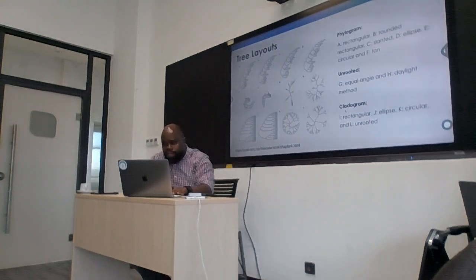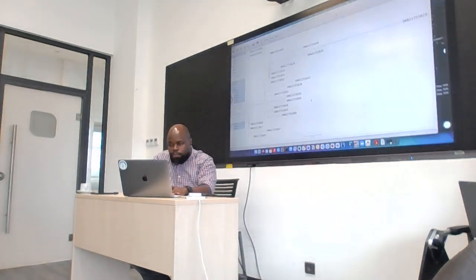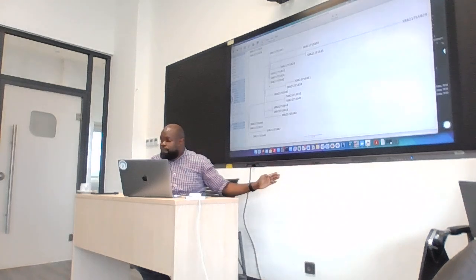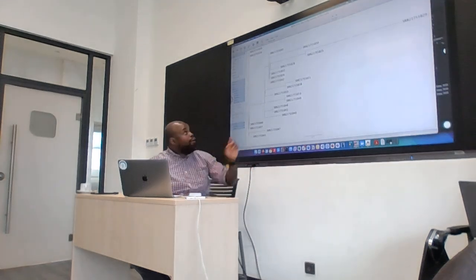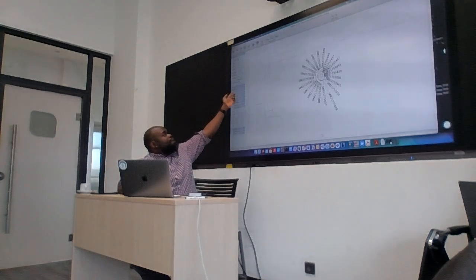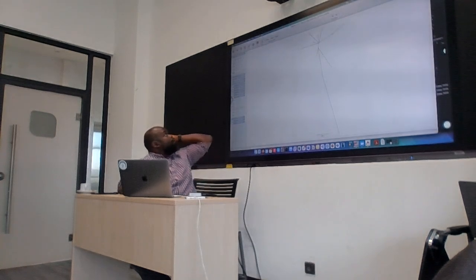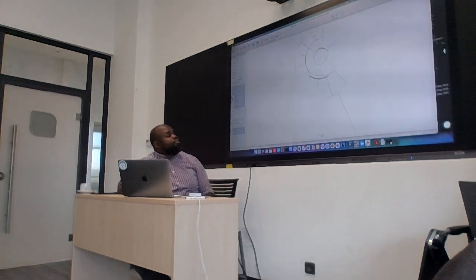And I can just quickly take a look back at my tree here on figtree. So if I go here at the top, currently we are on rectangular. Okay? I can make it circular. I can make it look star-shaped, or unrooted. So let me just remove the tips. Okay? So that is the same tree. That is the circular mode. And that is the rectangular.